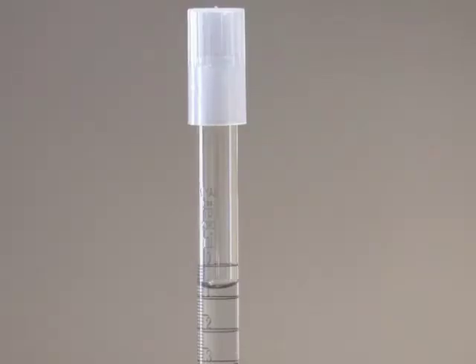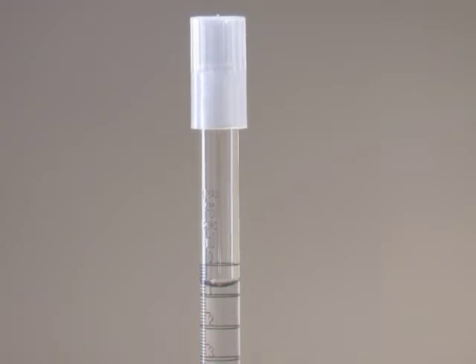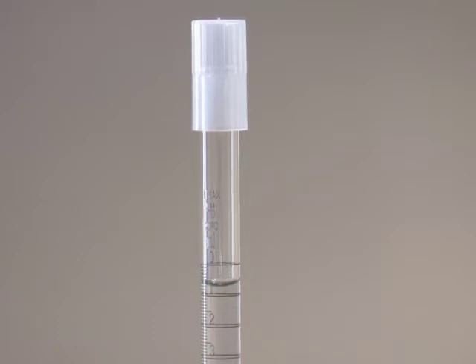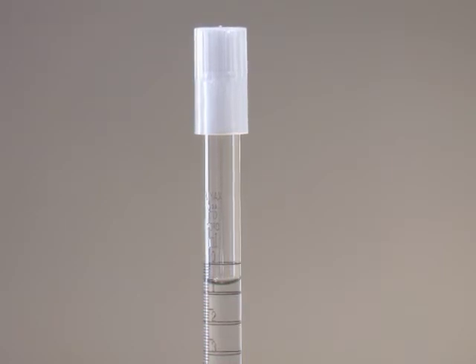If necessary, bring the liquid level back near the top. You don't have to start exactly at the zero mark. The meniscus must, however, begin somewhere below the line associated with zero. If you've used a funnel to pour into the burette, then remove it now so it does not drip into the burette after you've started your titration. That would lead to an error. You may also want to add a dust cap.